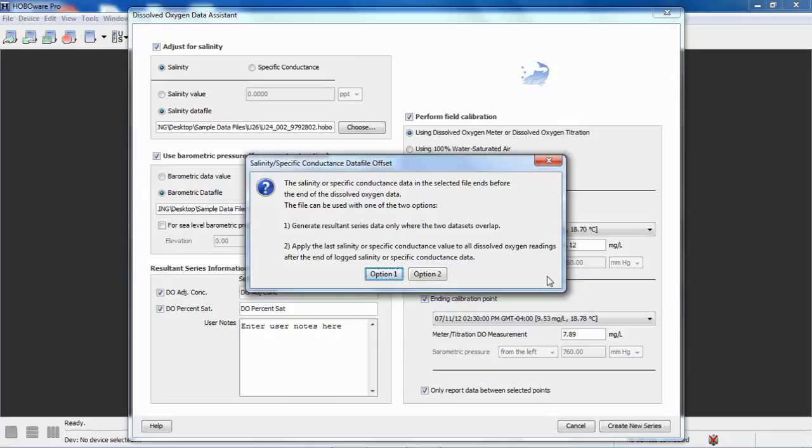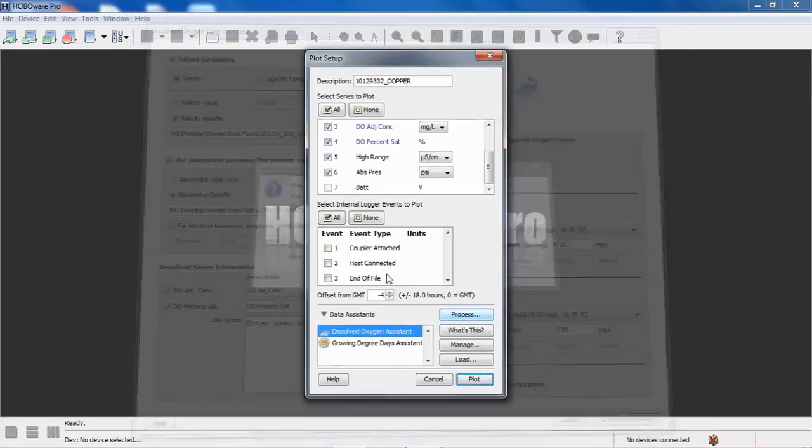So again, it gives you two different choices. One, you can choose to generate the resultant series data only where the two data sets overlap. That would be my suggestion. You could also just apply the last salinity value to all the oxygen readings after the end of the logged salinity or specific conductance data. But I like option 1, so I'm going to select that.